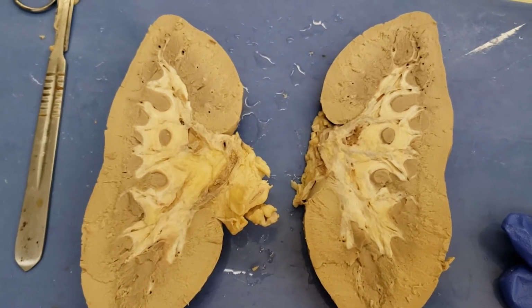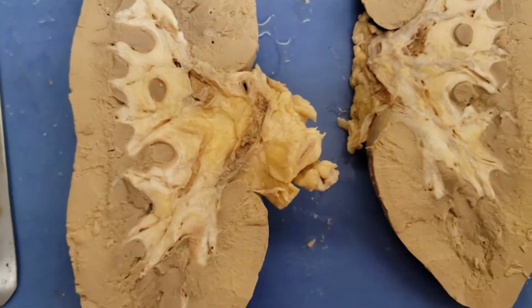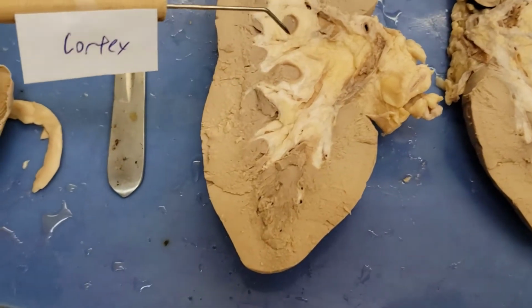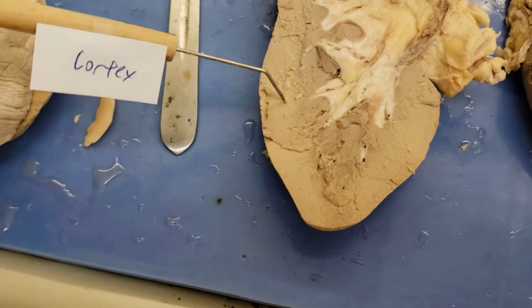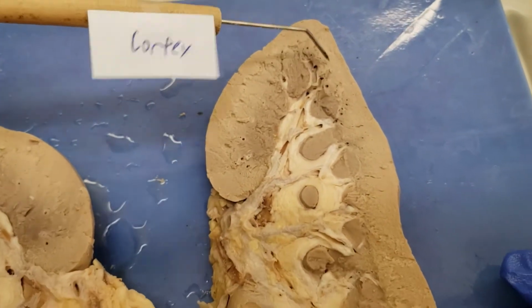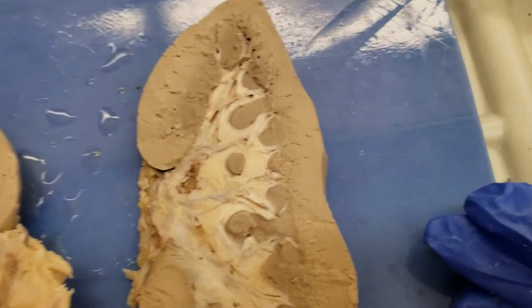So let's look at a few structures you have to know. And so let's take a peek. So we're going to start with the layers, I think, first. I think that helps. And you don't have to know too many of these. The outermost layer, following tradition we've mentioned before, is the cortex. Cortex, found there. It's the outermost layer, and that is kind of what we've seen so far. We talked about a lot of structures in this course. So cortex, outermost layer, seen here and here. Now, it's important to note this wraps around even to here too. So it's like this outermost kind of protective layering of it.